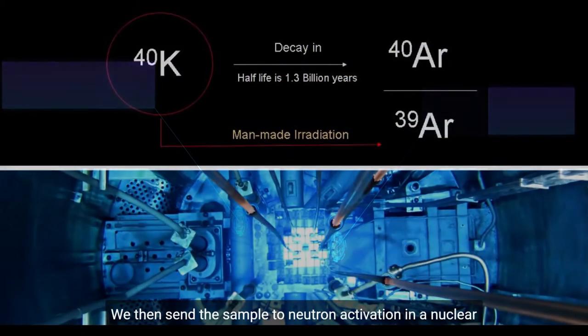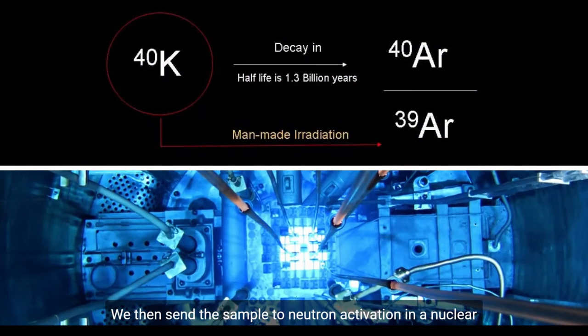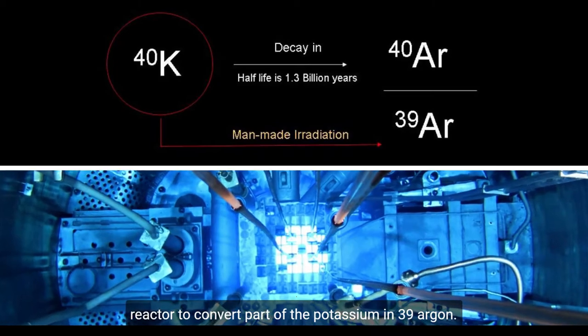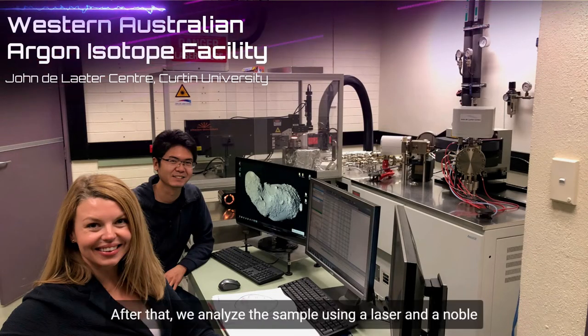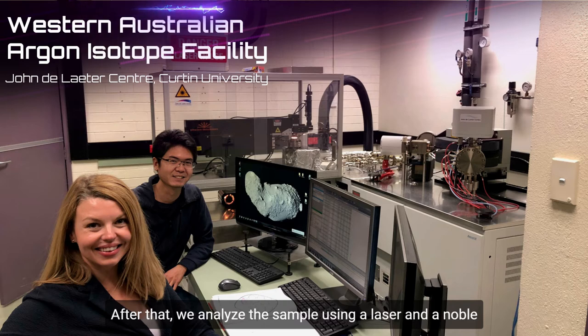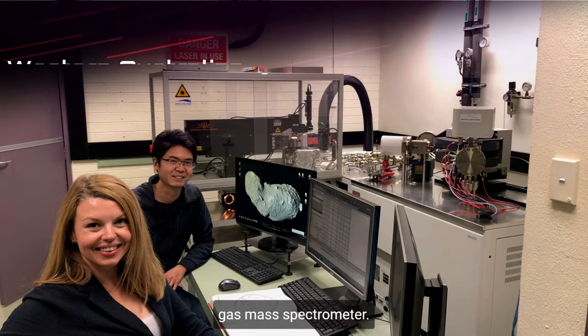We then send the sample to neutron activation in a nuclear reactor to convert part of the potassium into 39Argon. After that, we analyze the sample using a laser and a noble gas mass spectrometer.